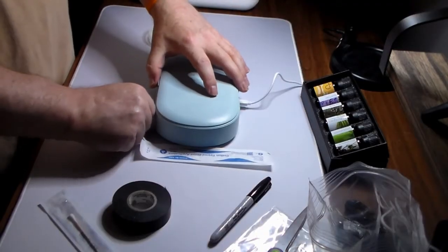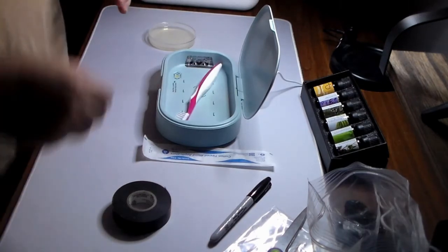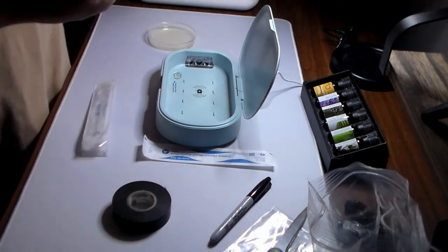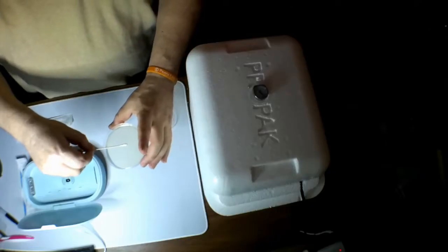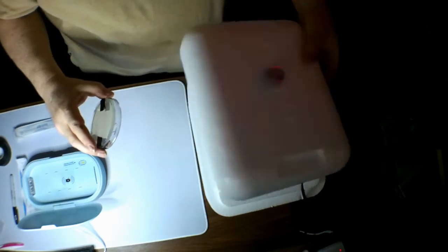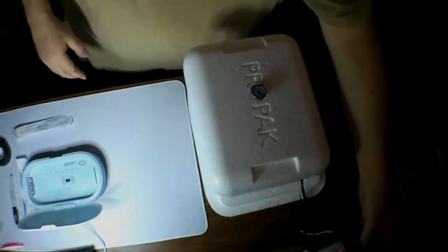Okay, the toothbrush is complete. Let's run this. I'm going to be a little less sensitive because I'm only going to be testing the bristles, so I don't have to worry about getting the handle contaminated or anything. So let's go ahead and swab the bristles. Temp's gone down a little bit, but I'm okay with that. I would rather it be low than too high.